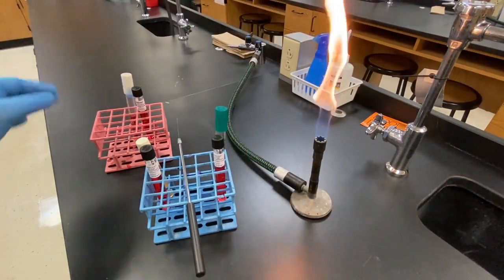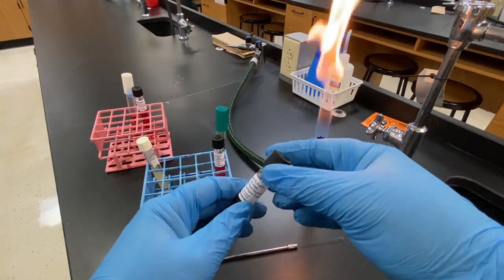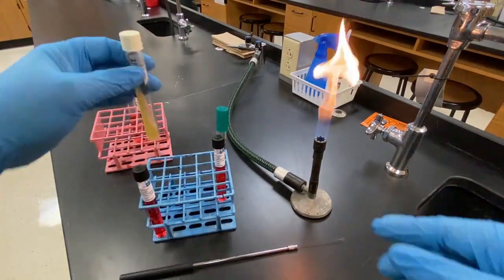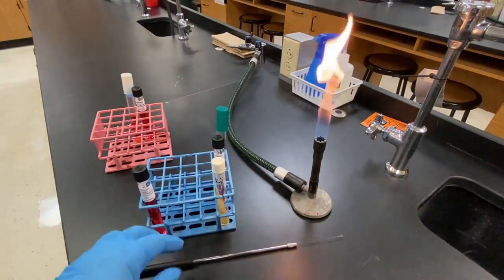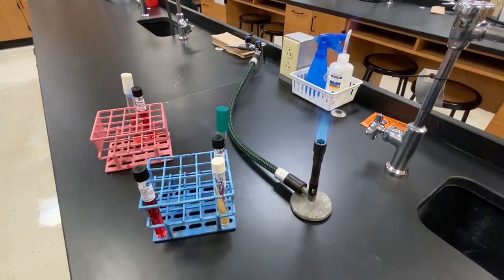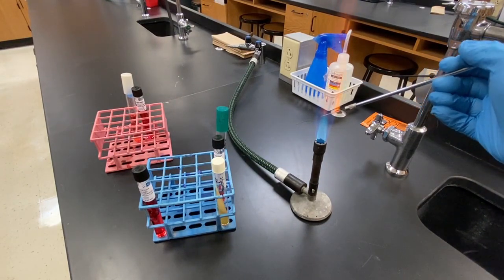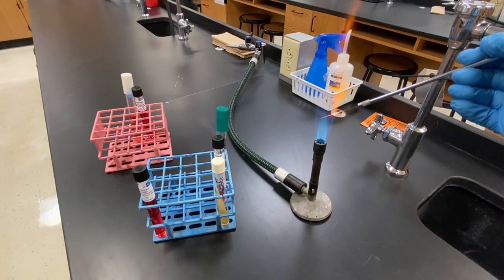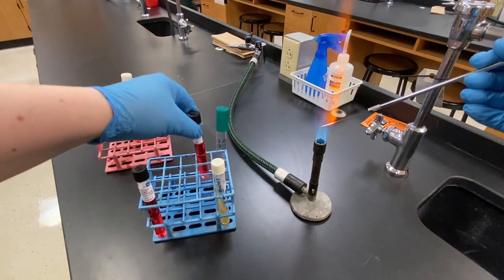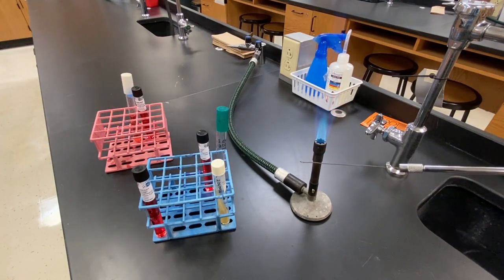The inoculating procedures are very similar to other procedures we have performed. The most significant element is the liquid nature of the broth. Here I am preparing my tubes and sterilizing the loop. Since we are moving microbes for growth, it is very important that you let the loop cool down completely before obtaining the microbes.